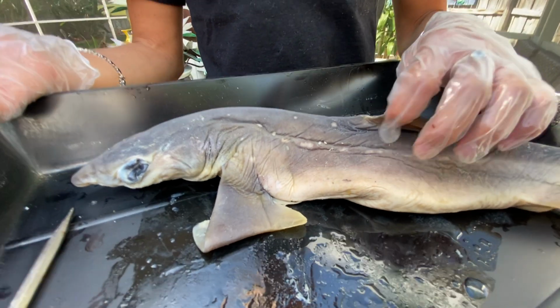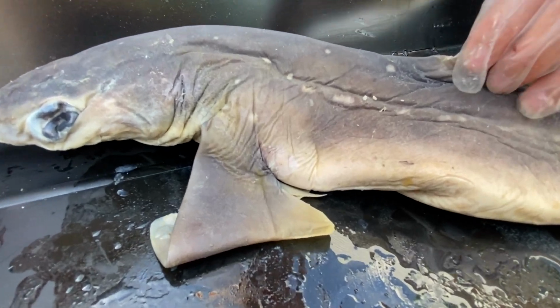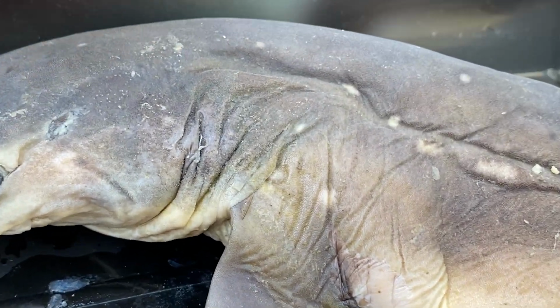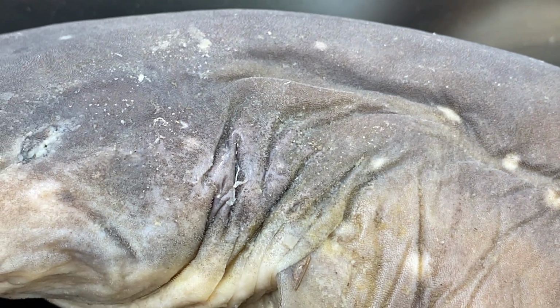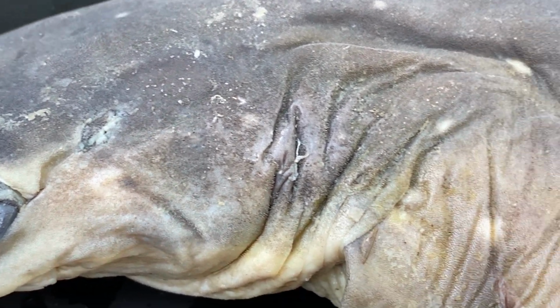Also in sharks, what they are very well known for are their scales. They have what we call dermal denticles. If you think dermal meaning skin, and denticle like dentist are your teeth. So literally dermal denticle means skin teeth. You can't really see it here because they are ridiculously small, but for the more scientific term of the scales, it is called a placoid scale.